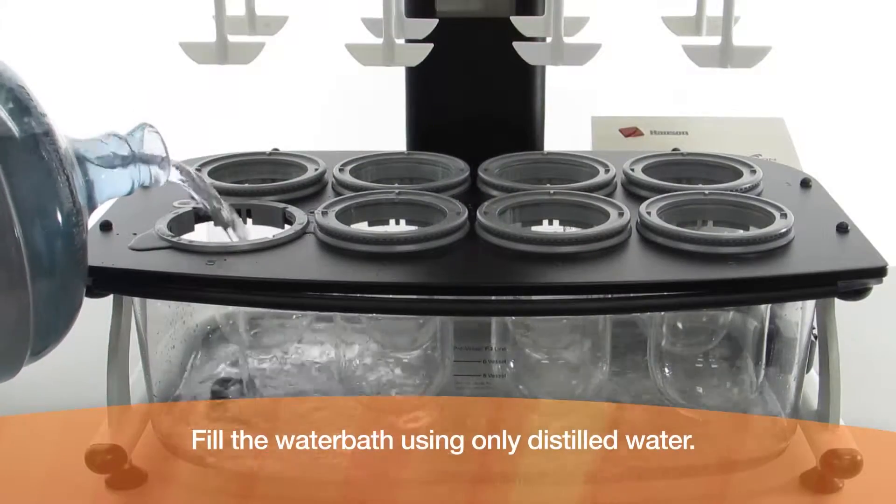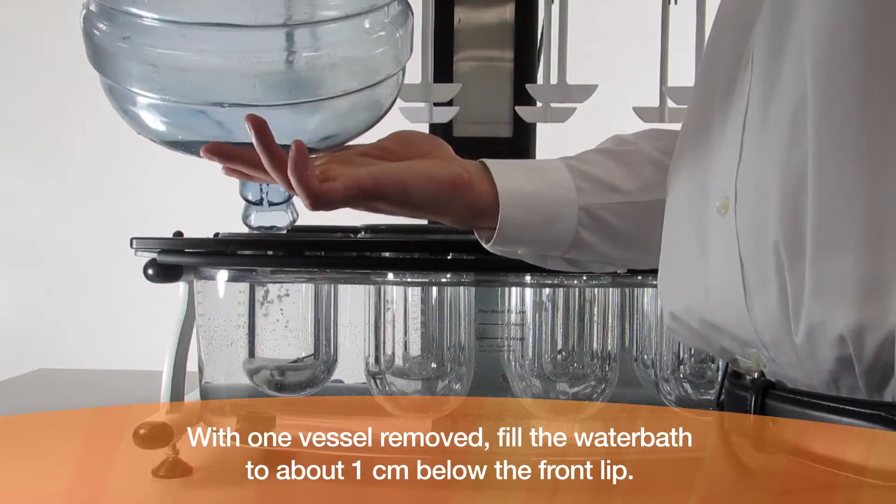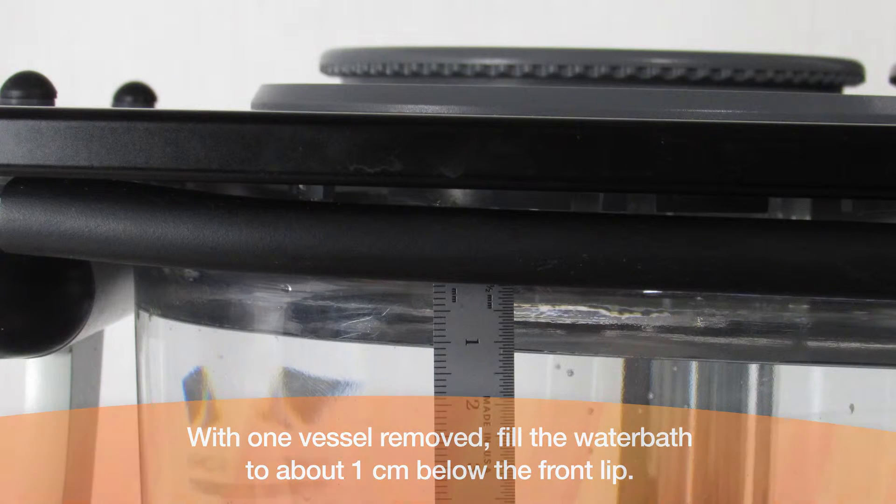Fill the water bath using only distilled water. With one vessel removed, fill the water bath to about 1 cm below the front lip.